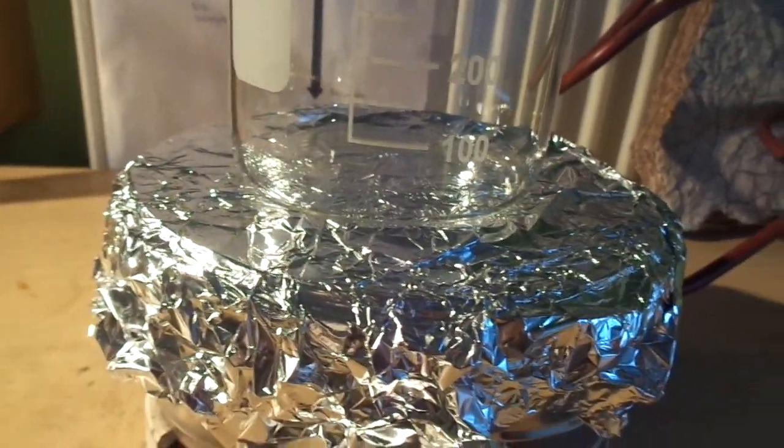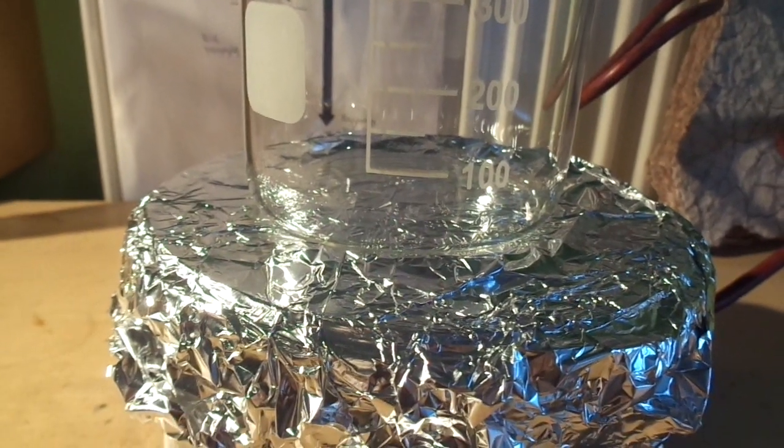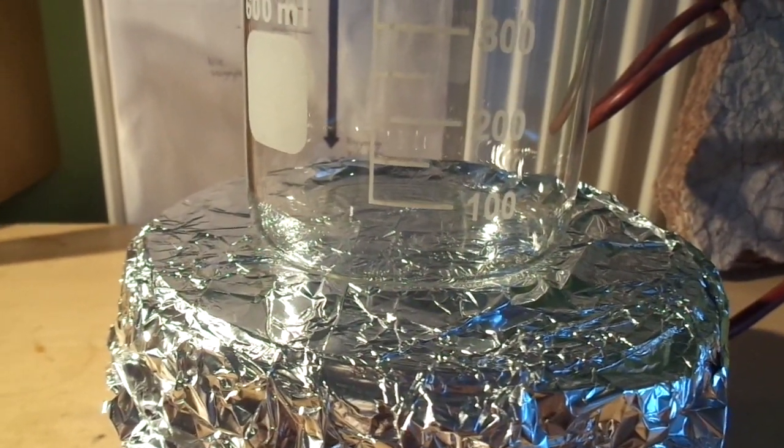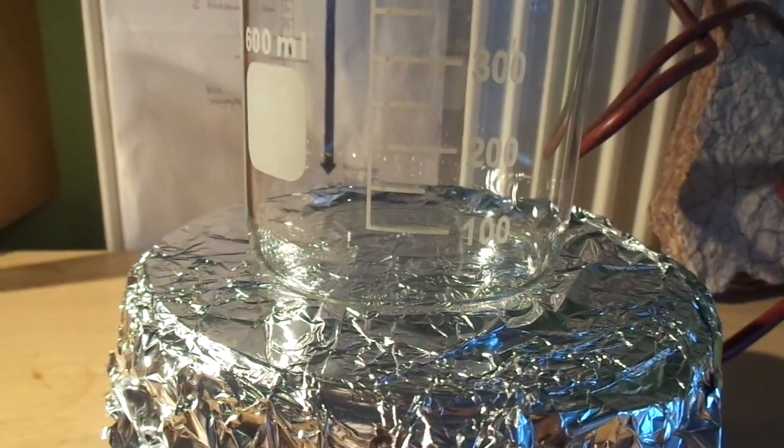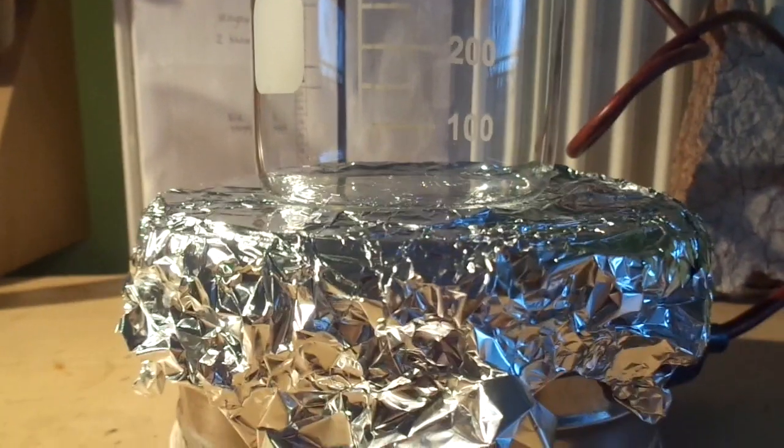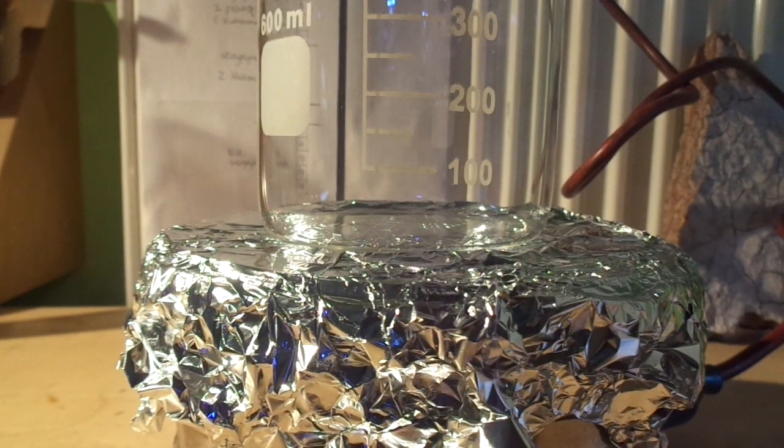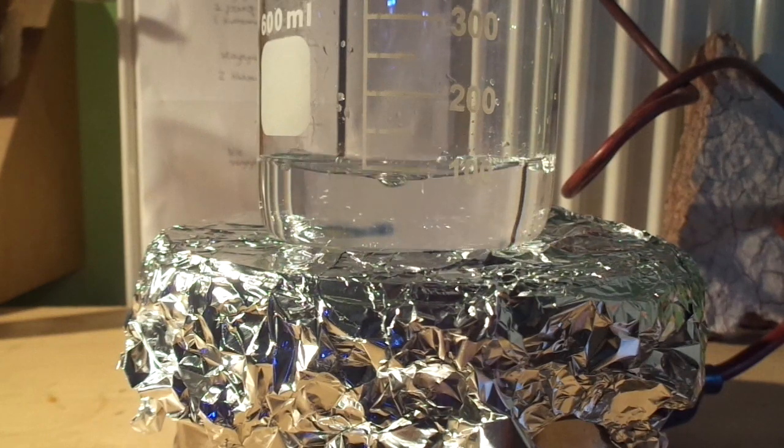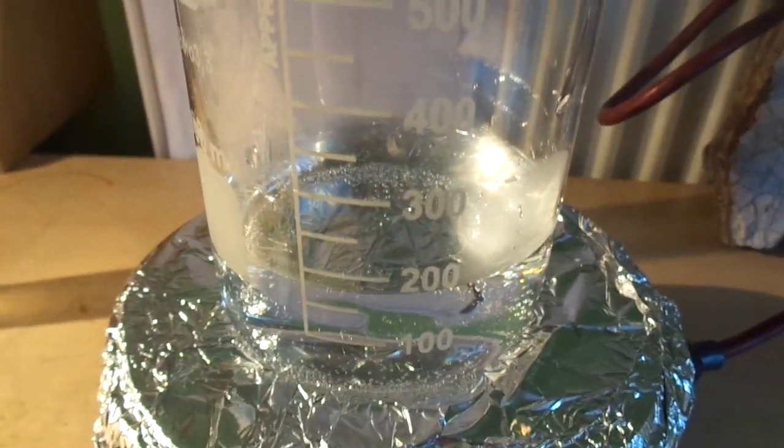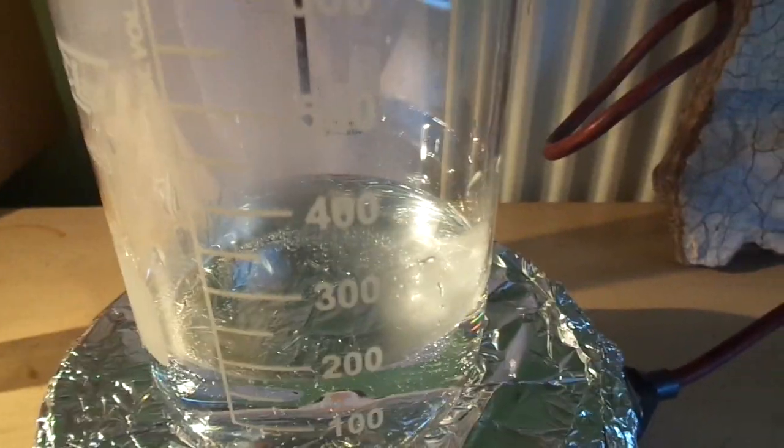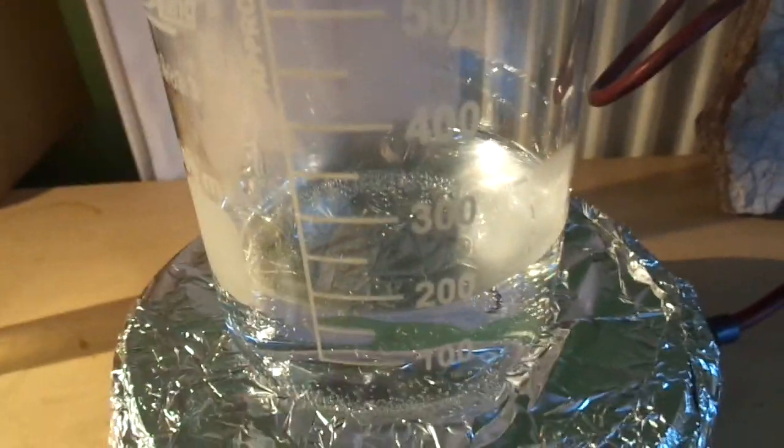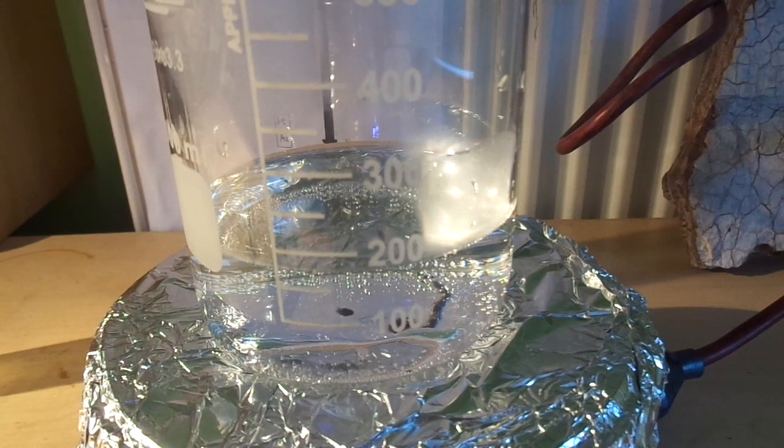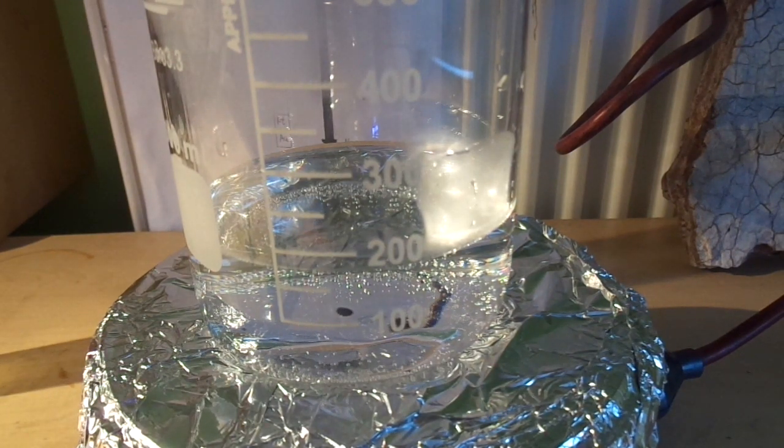What you need to do now is to dissolve the borax into water. You probably don't want to do it in cold water because it's not very soluble. So I'm just going to heat it up. The water is starting to heat up now and I'm going to put the borax, also known as sodium tetraborate.